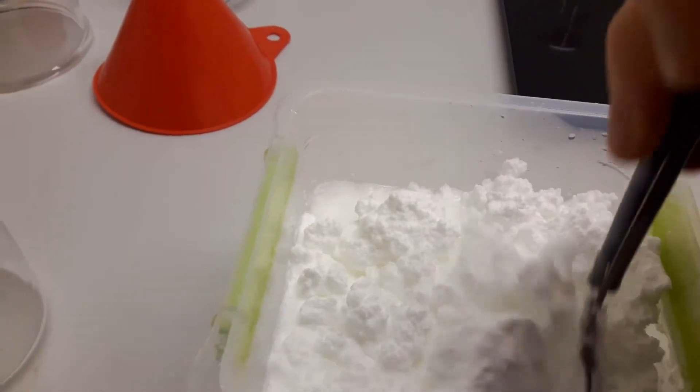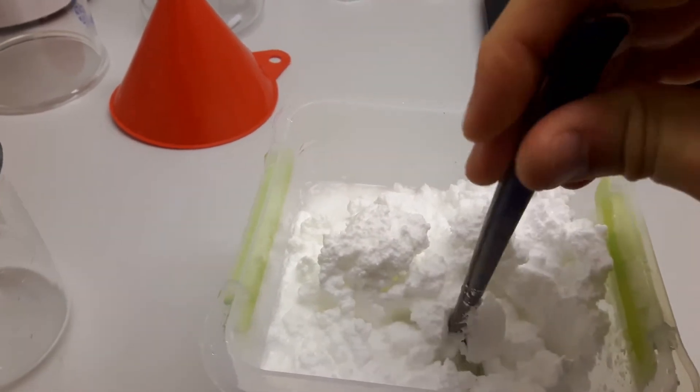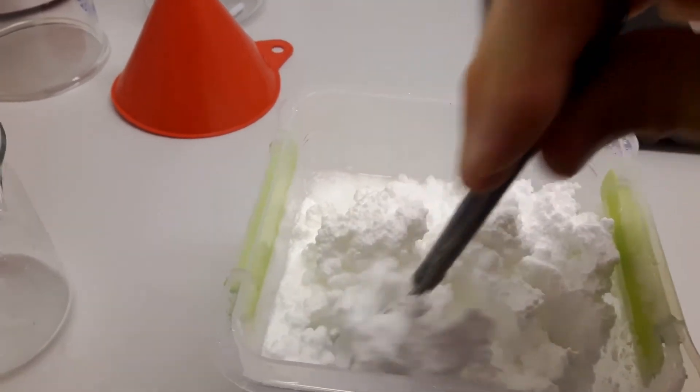This is not very useful, so I'm going to add more water to this until it is really a nice slurry that can be vacuum filtered.